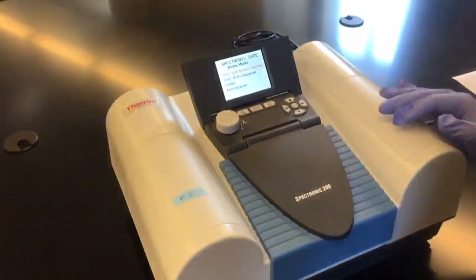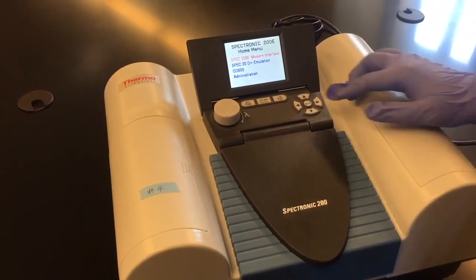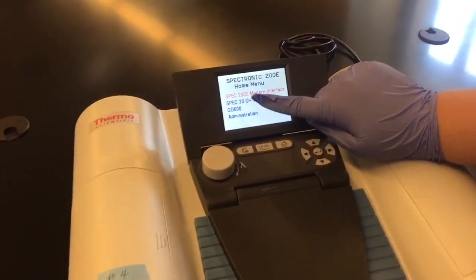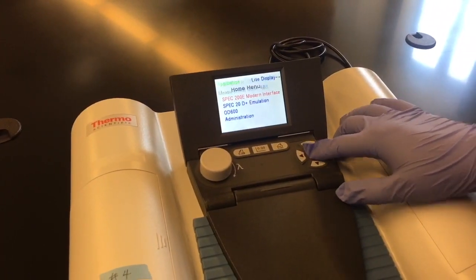After your spectrometer has warmed up, this is going to be the home screen. You're going to want to go to Spec 200e Modern Interface and press enter.